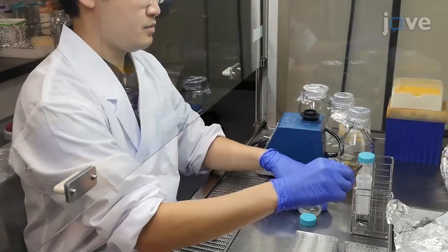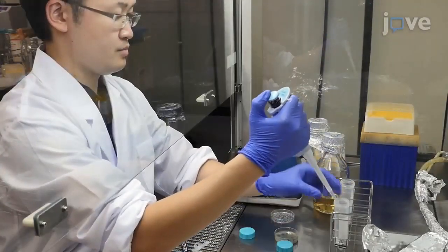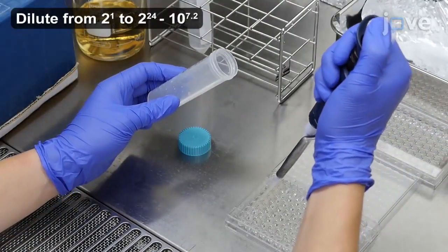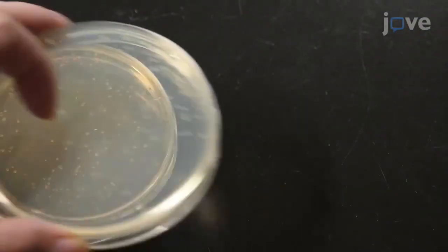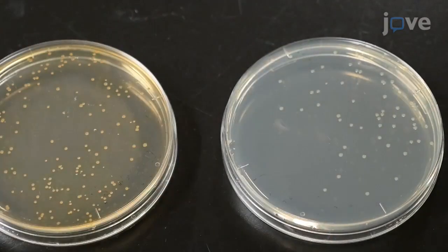At the end of the incubation, resuspend the culture on the filter in sterile LB containing kanamycin and gentamicin for serial dilution in a 96-well cell culture plate in quadruplicate. After 2 days at 30 degrees Celsius, manually count the colony-forming units, or CFUs, on the donor and recipient agar plates, and the number of wells in which the transconjugants grow by light microscopy.